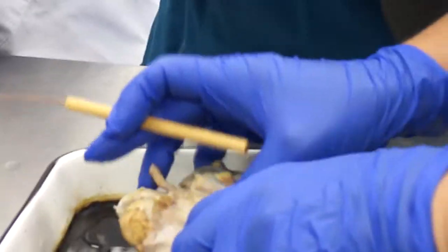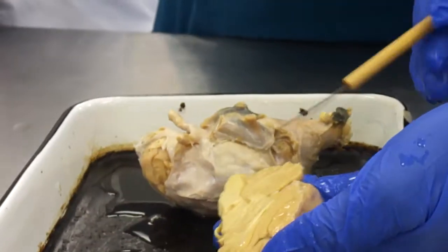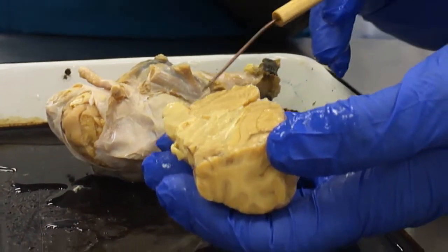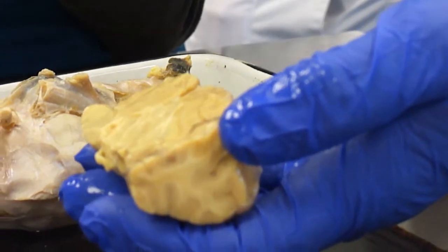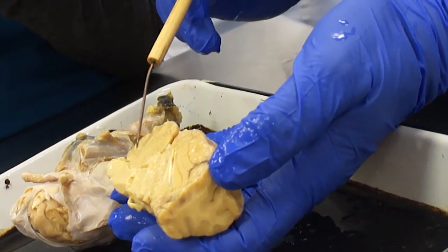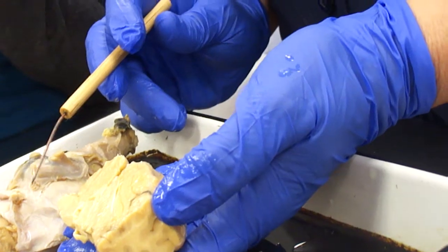And then sagittally, what we do is we cut down the longitudinal fissure and open the brain out. So you can see sagittally what we've got. So again, the cerebellum. And we'll talk about gray matter and white matter in class. The gray matter is the cell bodies of the neurons, and that's the actual thinking part. And the white matter is just dendrites and axons. But it makes a really neat structure in the cerebellum here. Look, it's called the tree of life. It's actually called the arbor vitae, the tree of life.